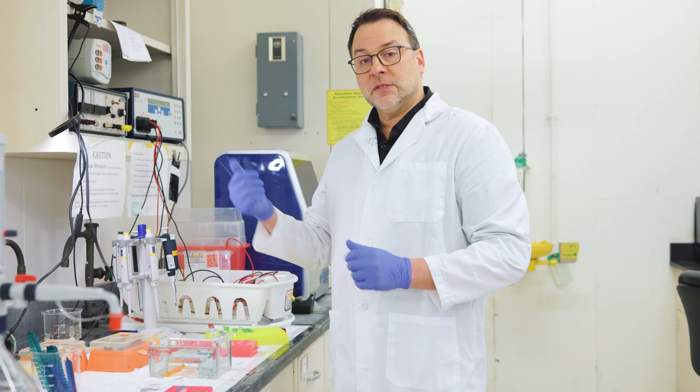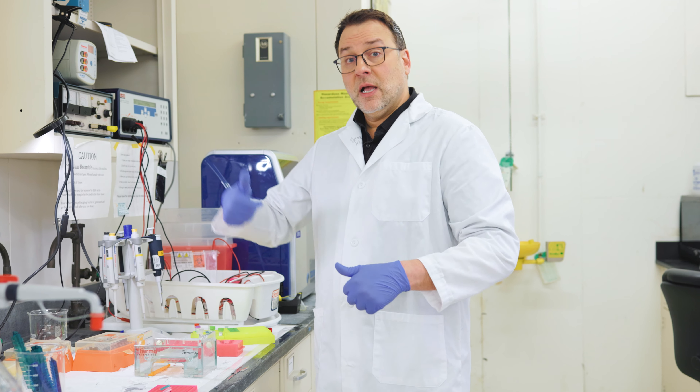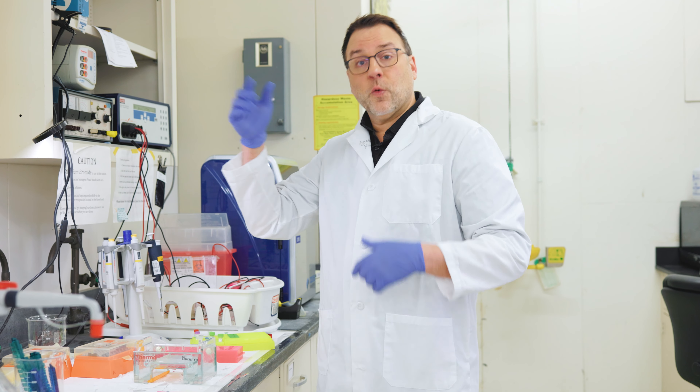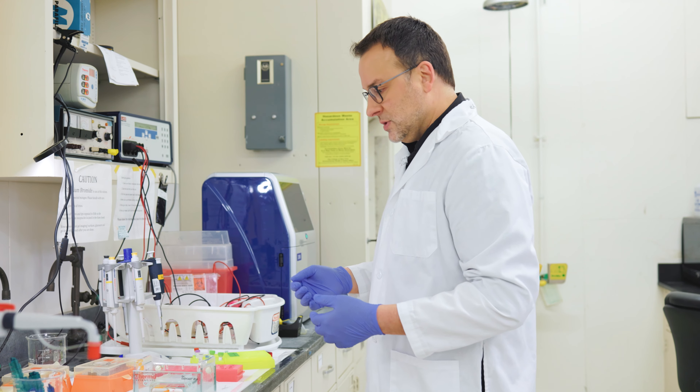That means I was successful. I can take what's left in here, send it off to be sequenced, and then I'll have that DNA sequence that I can use to query a database and figure out where that seed was from.